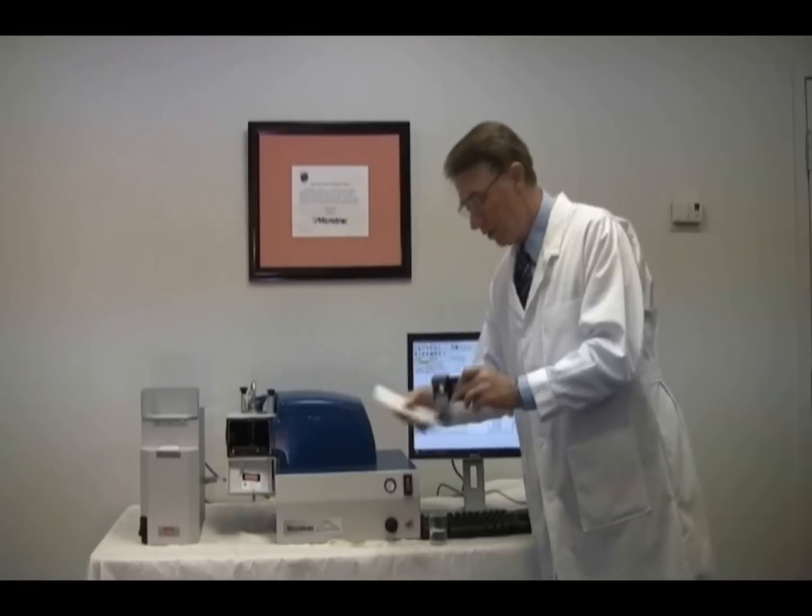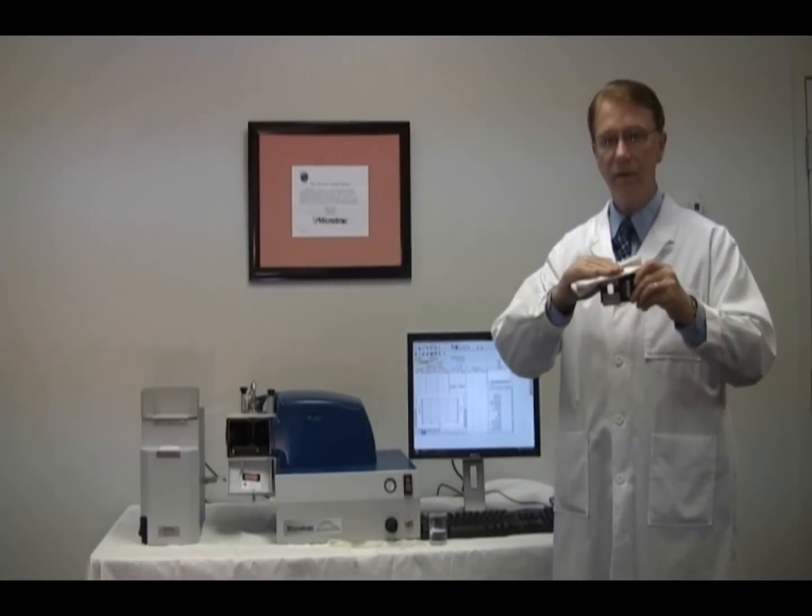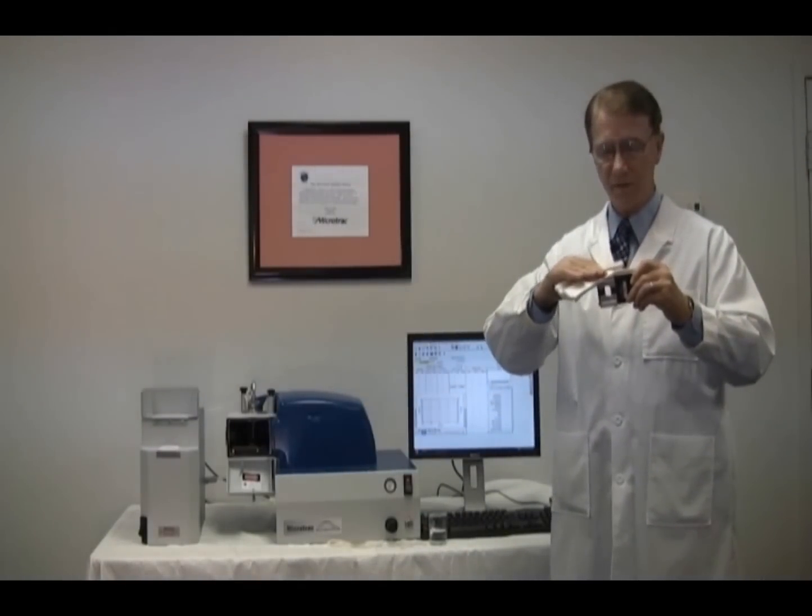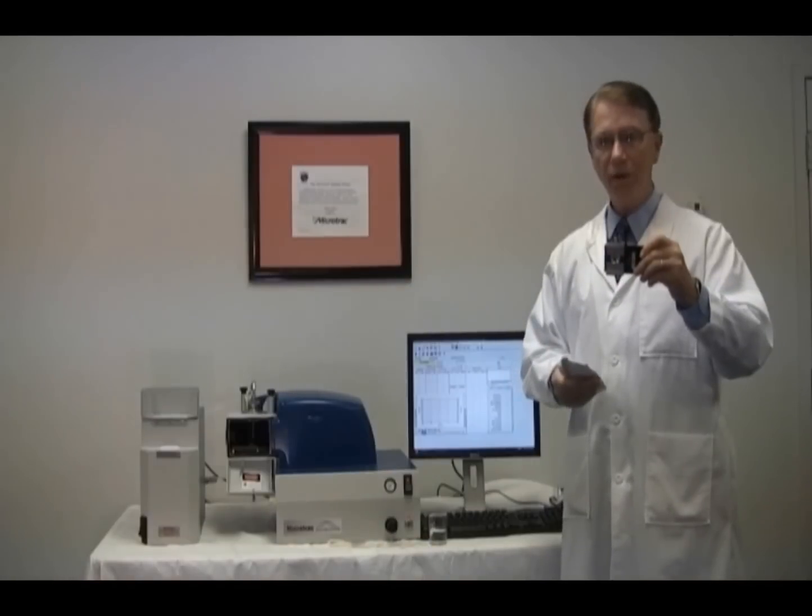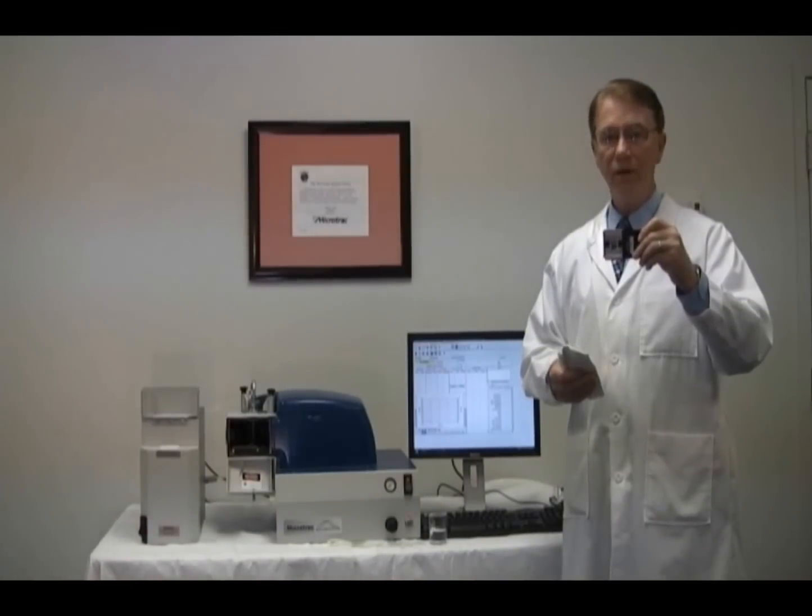After cleaning, dry the bottom of the cell and dry the top of the cell. At this point, the cell should be nice and clean. In the next segment, I will show you how to replace the cell, fill the system, and do a successful set zero and alignment.